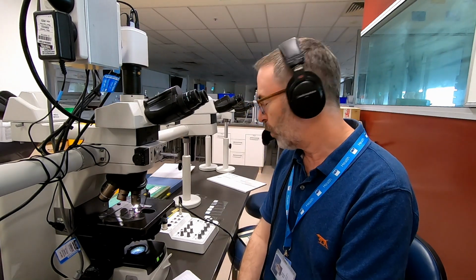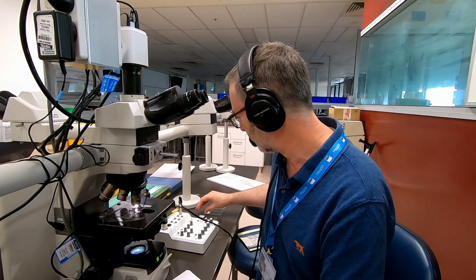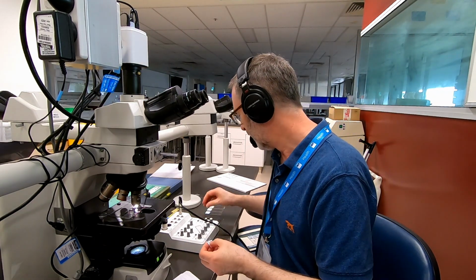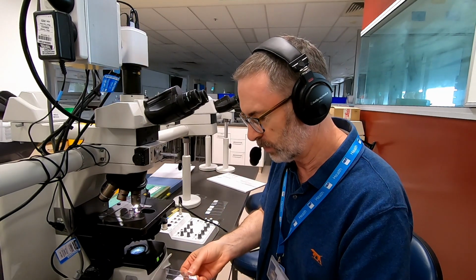Okay, so where we left off the other day, I had a rather poor demonstration of a melanin bleach by one of our students in week 1, which really surprised me because the majority of students were actually producing excellent slides. But sometimes it happens, minor things happen, time pressures and everything else.